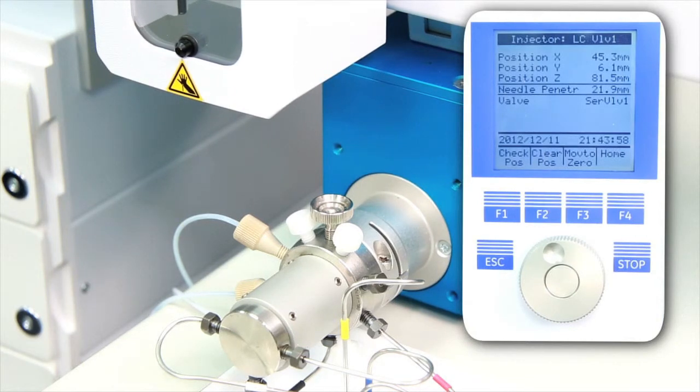You want to verify the defined needle penetration depth value by repeating this at least five times to be sure it does not hit bottom. Then hit home, F4, to reset the injection needle.